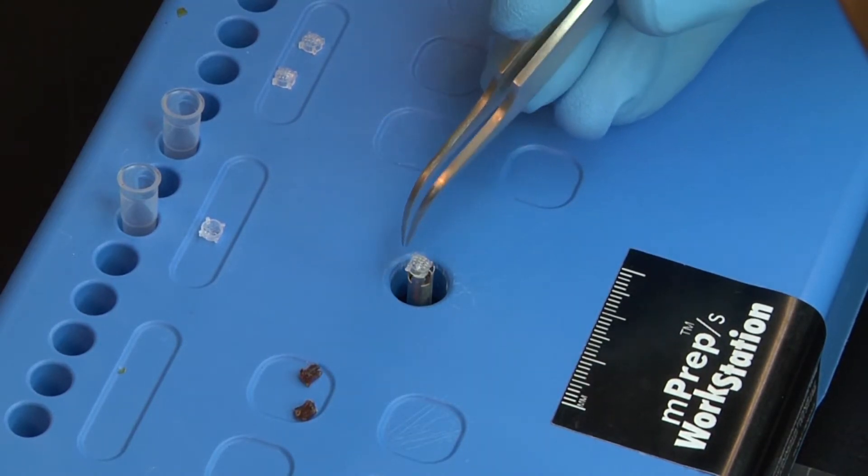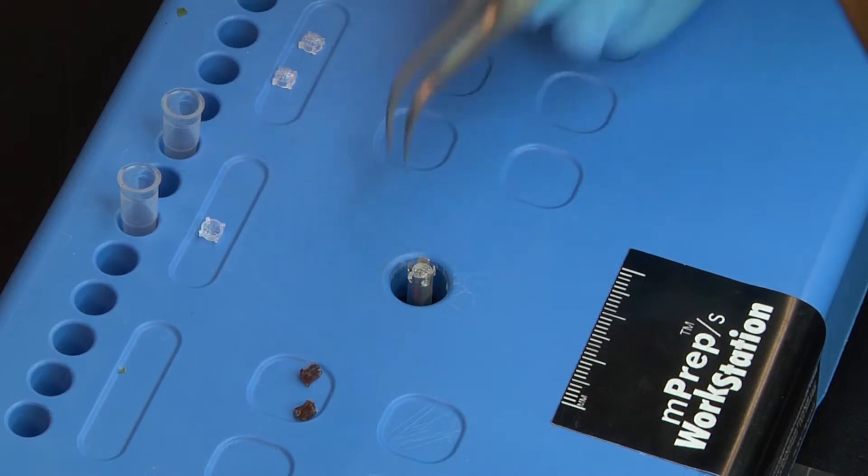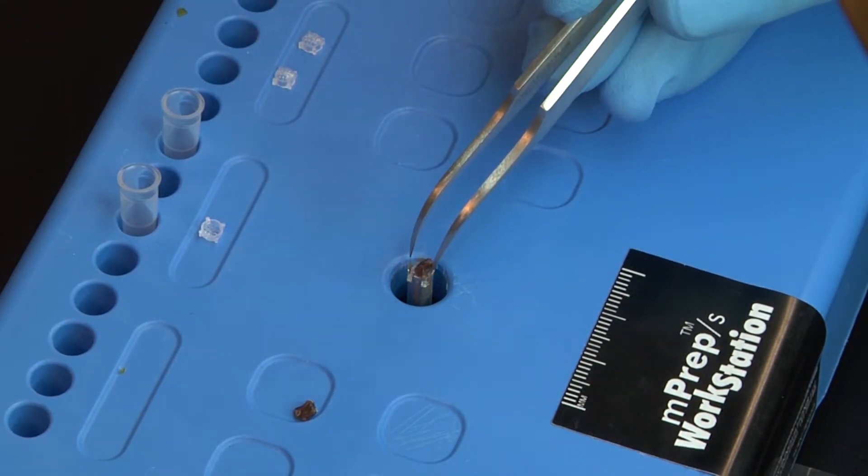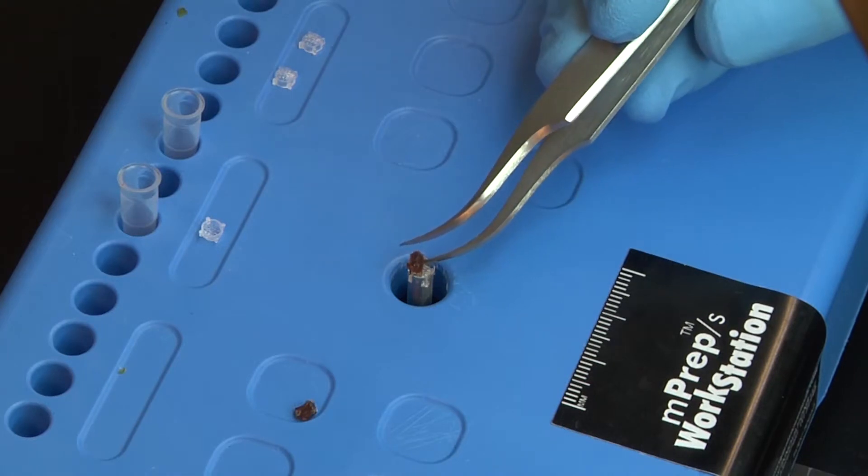Because the screen will not be spread to open the slit, it is not necessary to ensure that the tabs are engaged with the insertion tool's slots. Then place a specimen on top of the screen in the desired orientation.